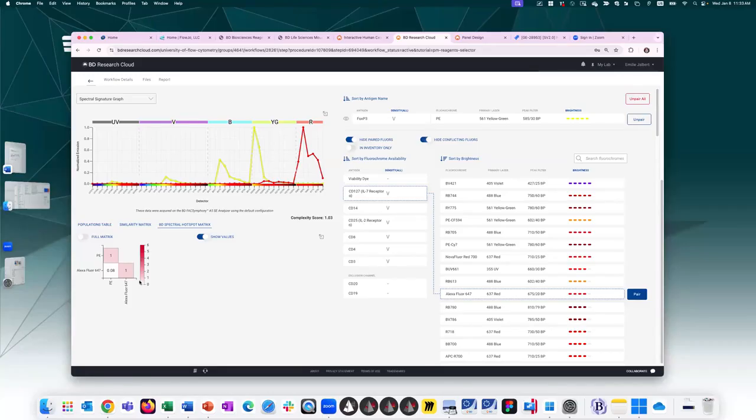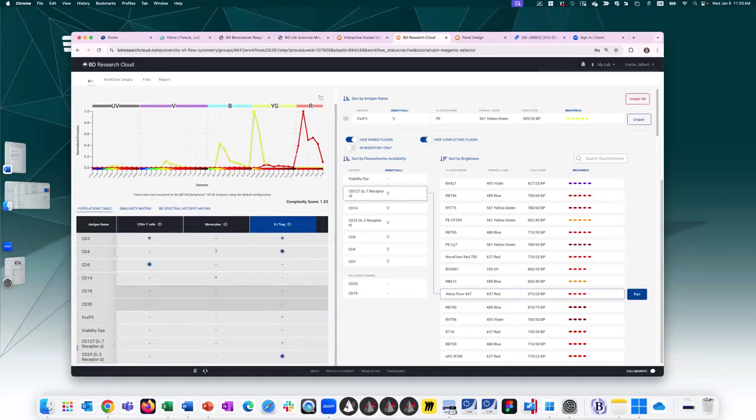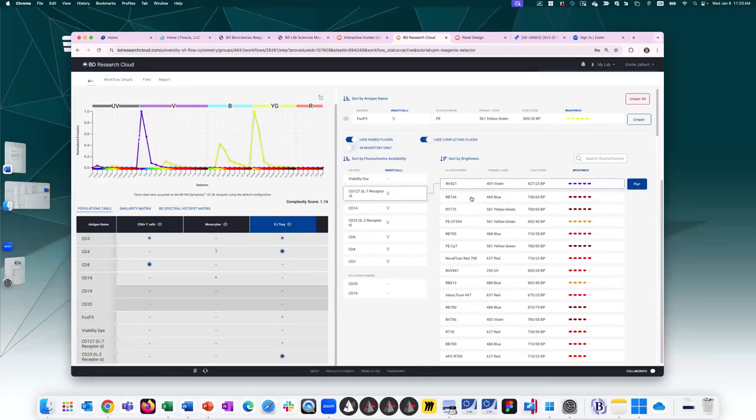Of course, this will depend on your panel size. The more fluorochromes you try to put in there, the more you'll have the opportunity to maybe have this creep up in value. But that said, if I want to assign a fluorochrome to this marker, I look at the antigen density of CD127, which is low. I want to assign it something that's nice and bright.